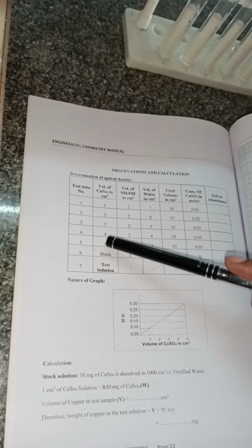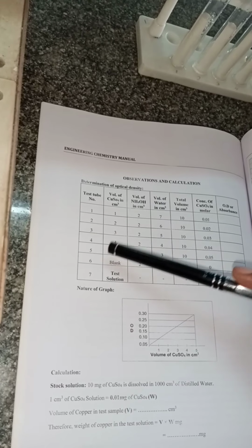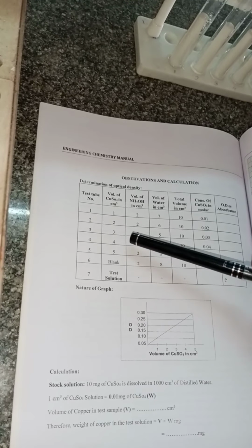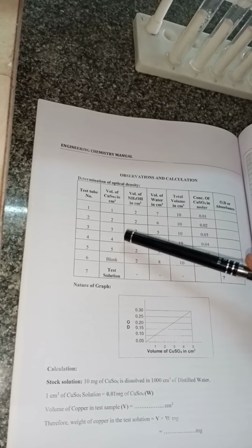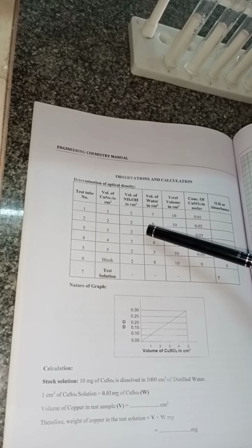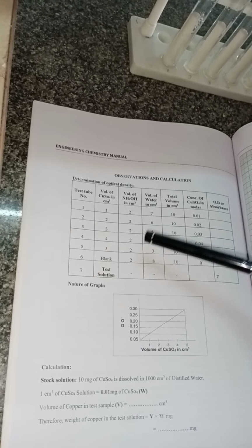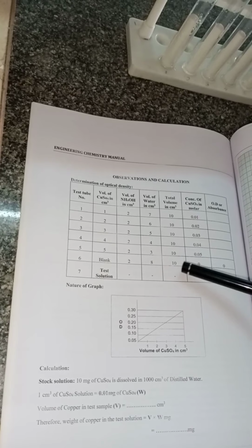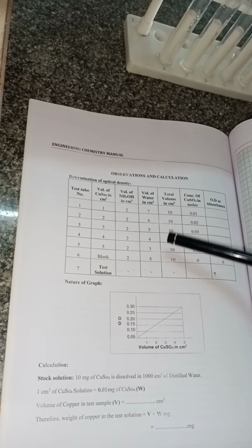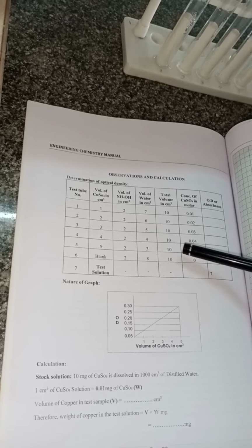Likewise, we prepare 5 different concentration solutions, by increasing copper sulfate in 1 ml increments in each test tube, with 2 ml of ammonia kept constant for all the test tubes, and the remaining volume filled with water to adjust to 10 ml.